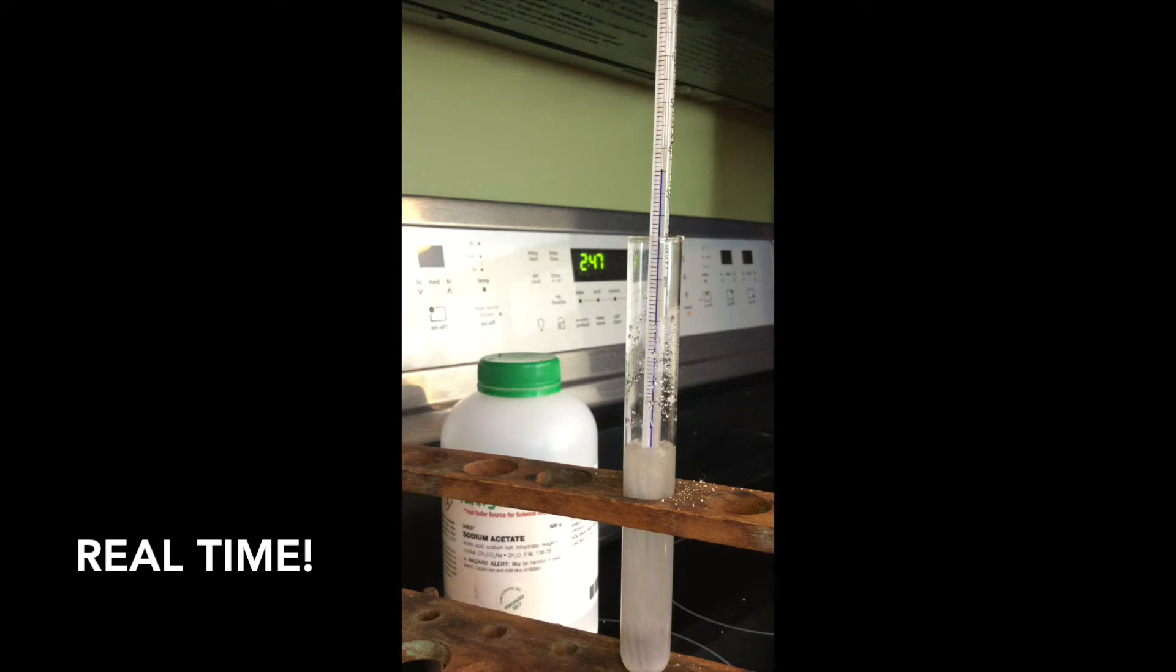Whoa. Look at the thermometer. Check it out. This is real time. This part is not sped up. It is freezing. And the temperature is spiking. I bet you mostly didn't see that coming.